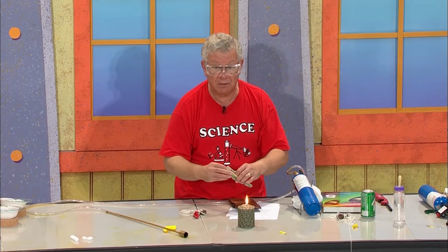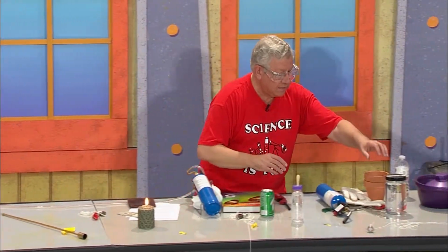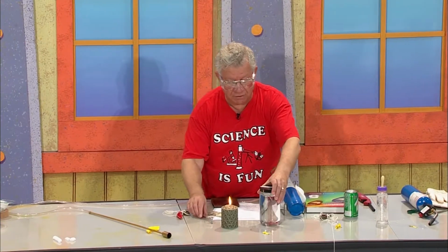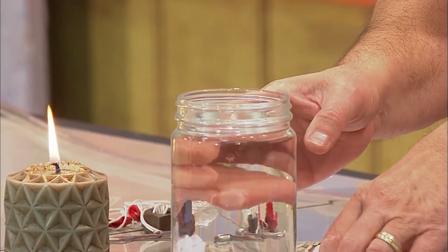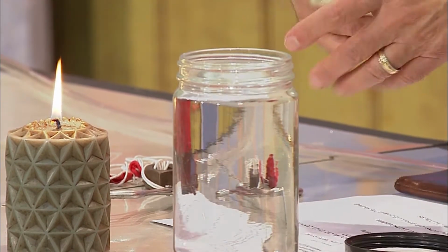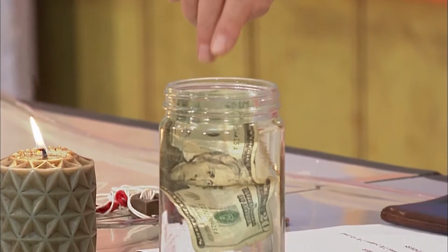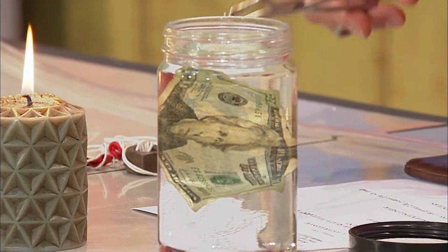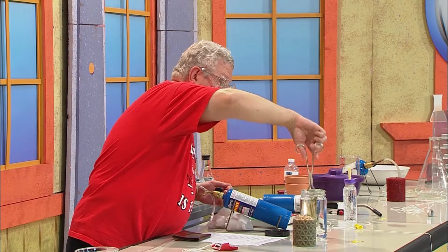The same experiment. I'll do the same experiment, but I want you to see that I have a jar here, and I have a liquid in this jar. What do you suppose this liquid is? Well, what does it look like? It looks like water. You know from experience what water looks like. So what I'm going to do is take the $20 bill. I'm going to soak it in this clear and colorless liquid. That's how we really describe this. Water is a clear and colorless liquid. And I'm going to try to fish it out.